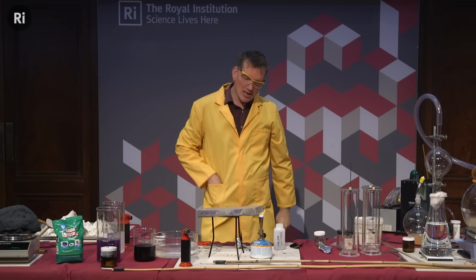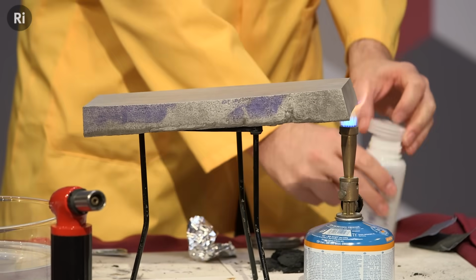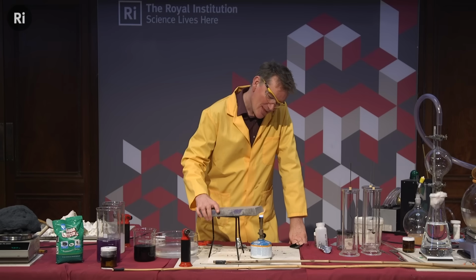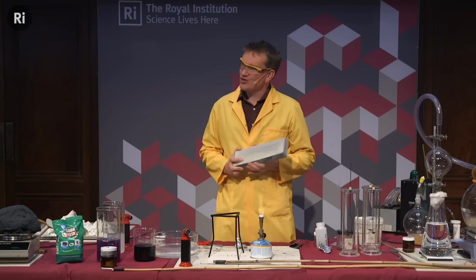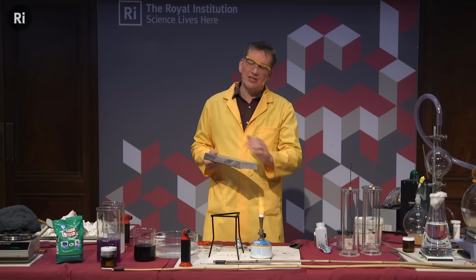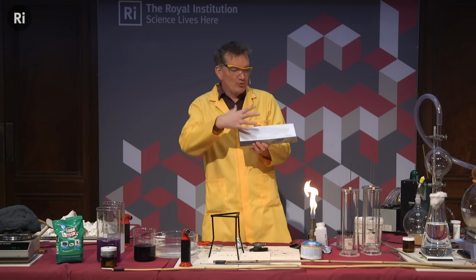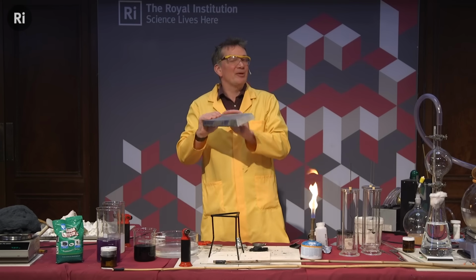Okay, well, what about my magnesium? It doesn't seem to be reacting, and actually, that's probably a good thing. It would be a bad day if this caught fire. But it's because it's too big. Okay, it's too big to react. This is because at the moment it's taking all of the heat from this Bunsen as I was heating it there, and the heat is being spread out and it's being slowly absorbed into the block here and dissipated from the block as well. So it's actually, I can still pick this up, it's not hot enough yet.